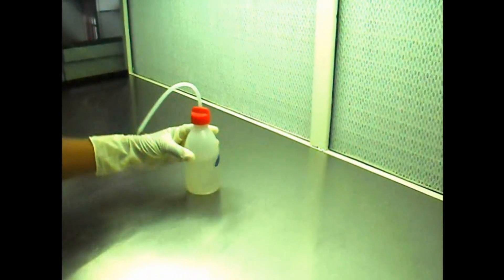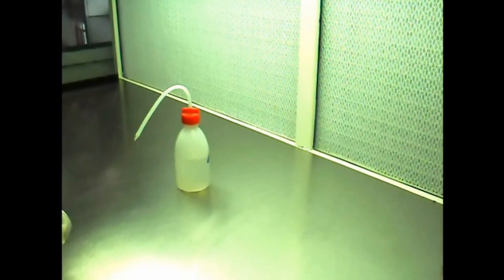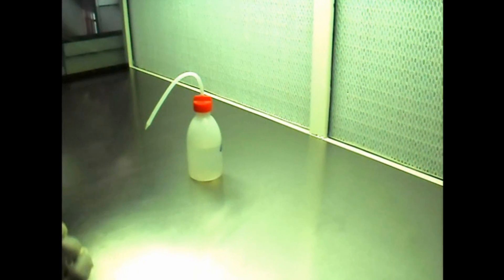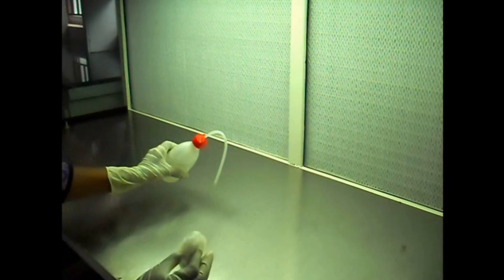Take 70% ethanol. Clean the working area with 70% ethanol.